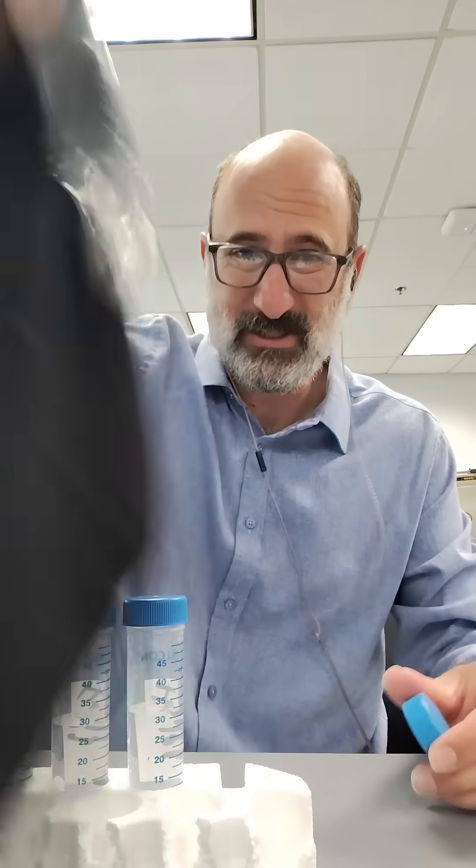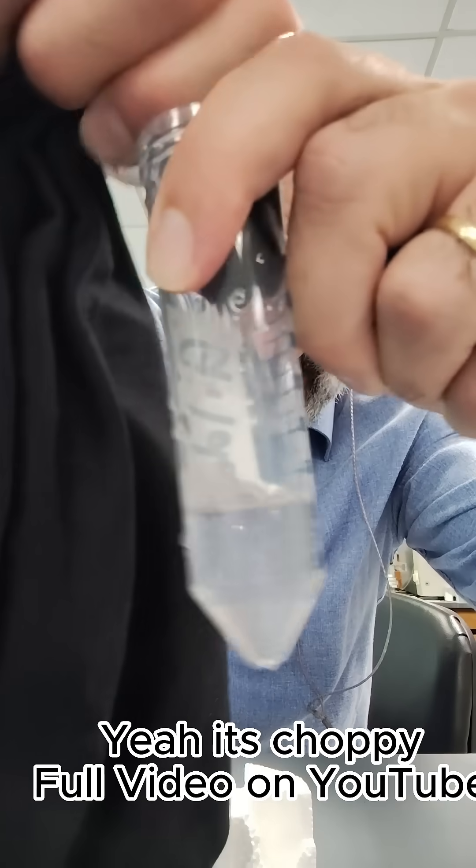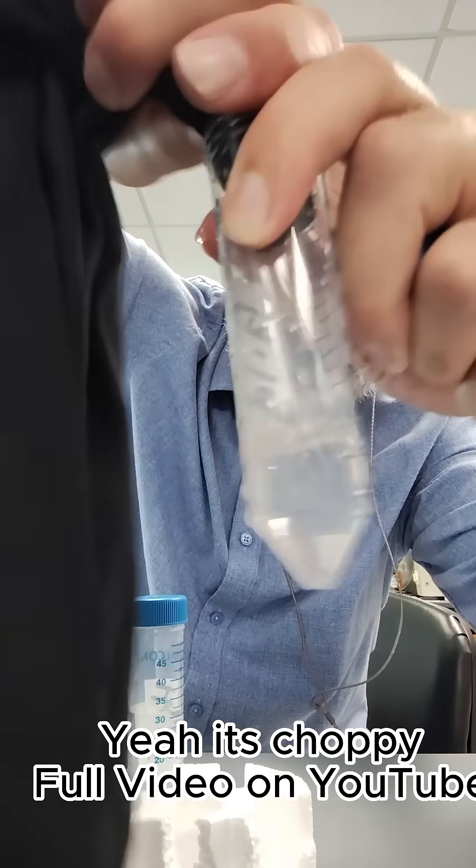We're wearing them unwashed and we're going to analyze them unwashed - what does the unwashed black t-shirt have in it? The next part of the process after shaking for about a minute is to squeegee it out, squeegeeing the water out.